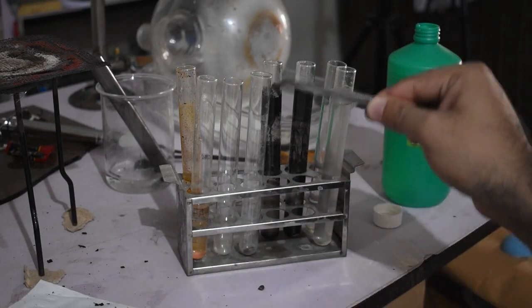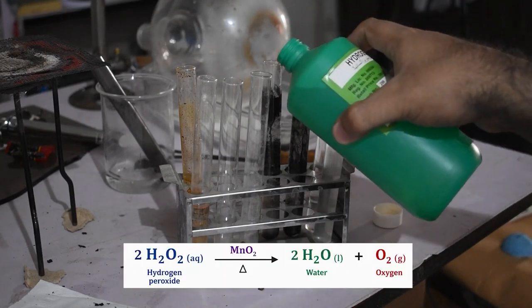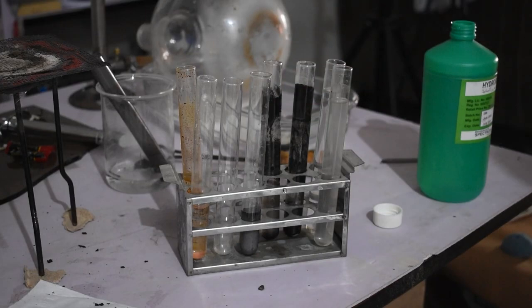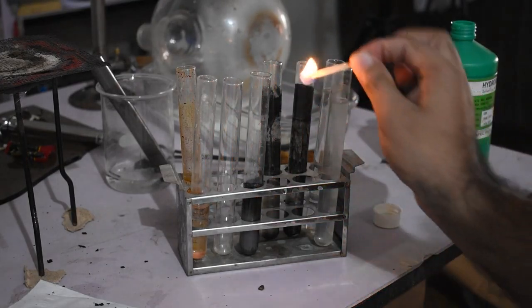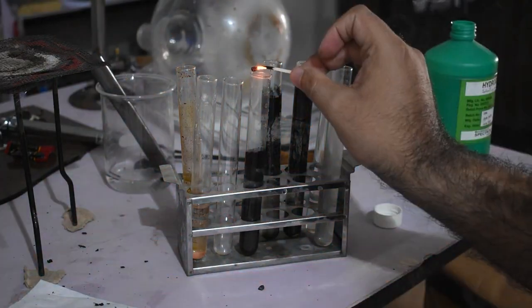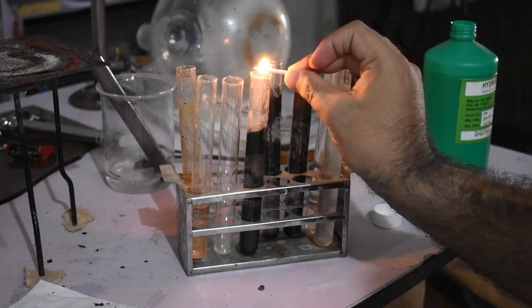We place a small amount of the battery's black powder into a test tube and add hydrogen peroxide. Oxygen gas begins evolving almost instantly. Unlike hydrogen, oxygen itself is not combustible. Instead, it supports combustion. If a glowing wooden splint is introduced into the oxygen, it immediately reignites. This is the classical laboratory test used to confirm the presence of oxygen gas.